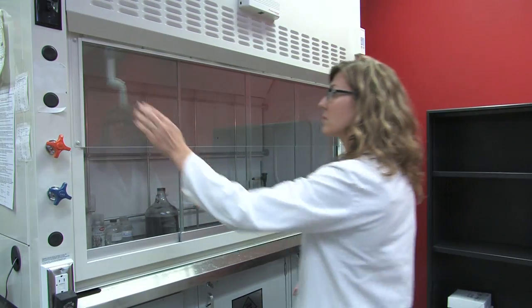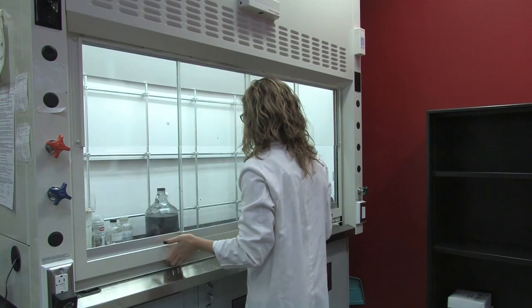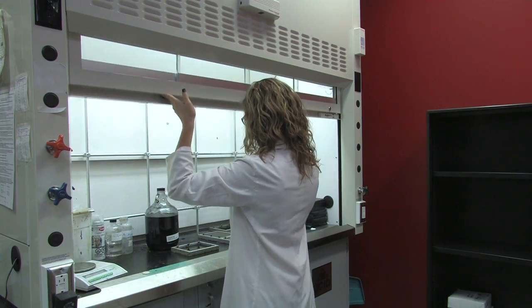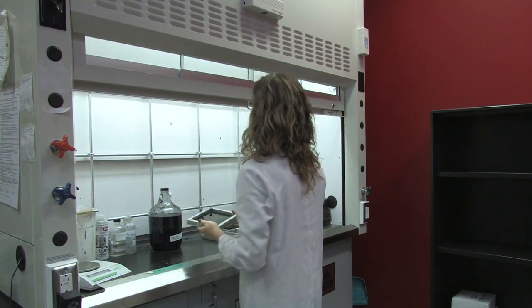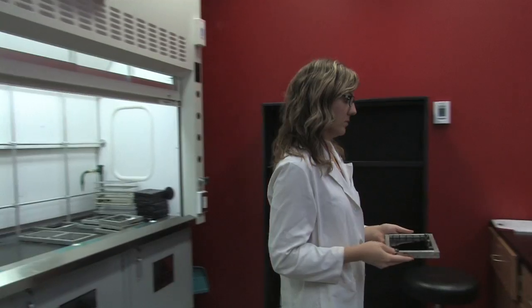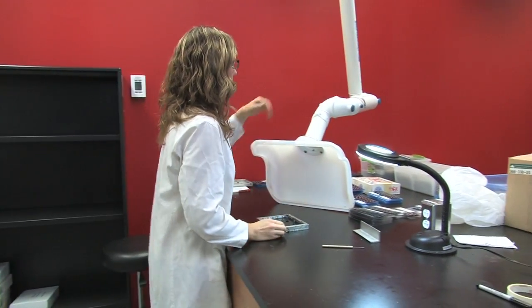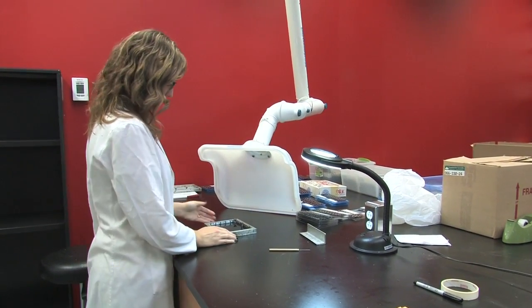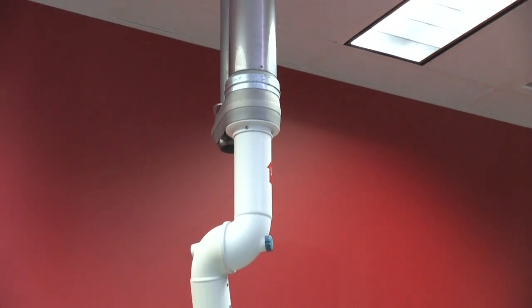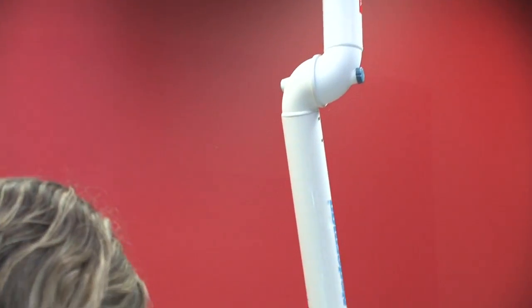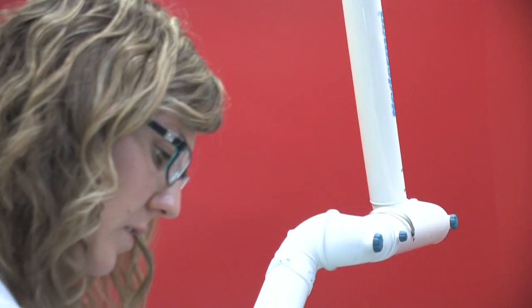Once the epoxy is set after one day, it is ready for the otoliths. Remove the tray from the fume hood and place it under a desktop vent. In this lab we are equipped with portable vents which are also appropriate to use when working with the trays outside of the fume hood.